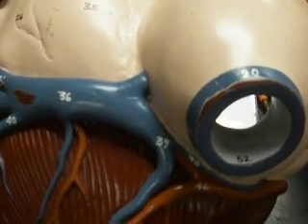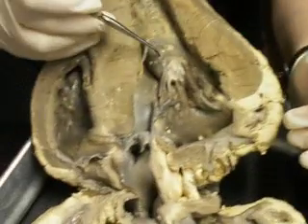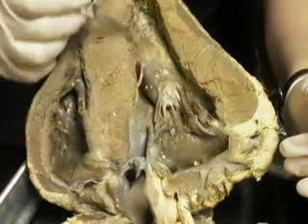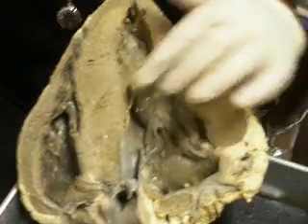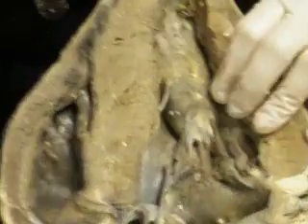Is that a papillary? Hold on, you're moving. That's trabeculae carneae. Papillary muscles are here. It's where the chordae tendineae end. So what's that? This is just part of the ventricle. Oh, okay. Is that myocardium muscle? Well, it might be still considered myocardium. I guess it is, yeah.